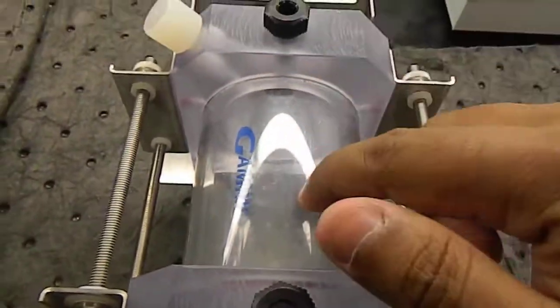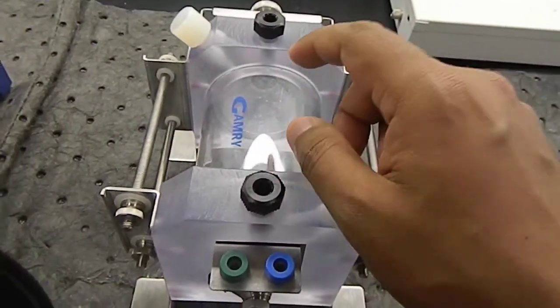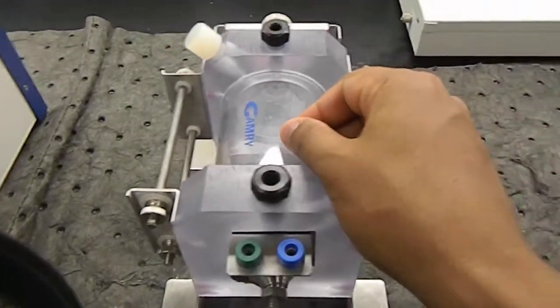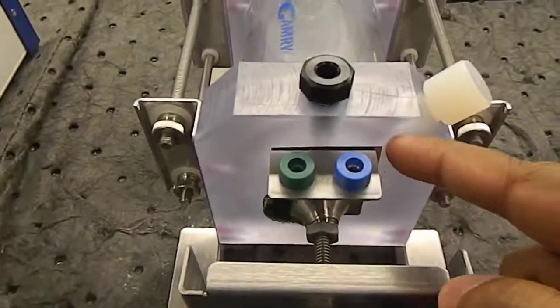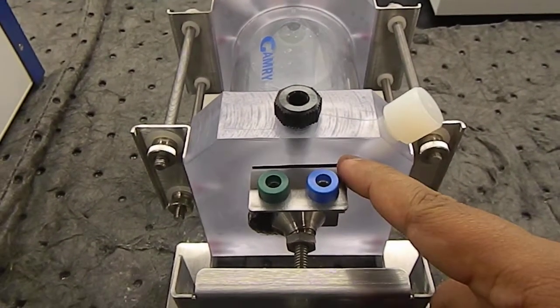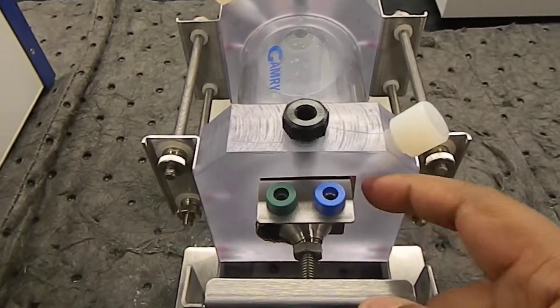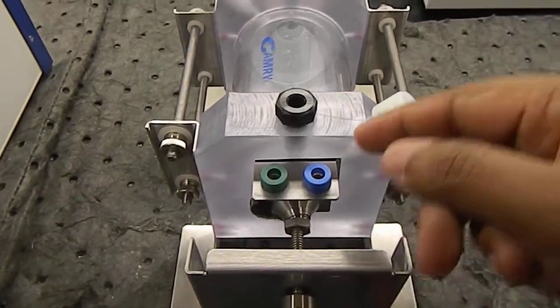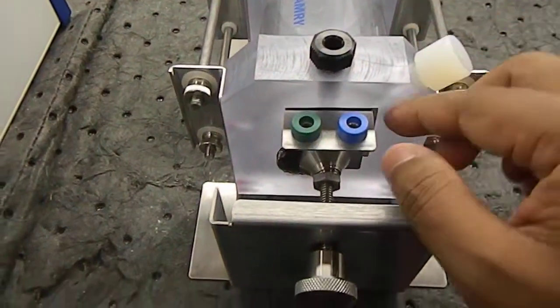Now in this cell you have to pour in the corrosion liquid you have to work with. It depends on your application, on which application this metal piece is going to be used, because corrosion parameters will change. The Tafel parameters and the pattern of the Nyquist curve will change as per the corrosion liquid.